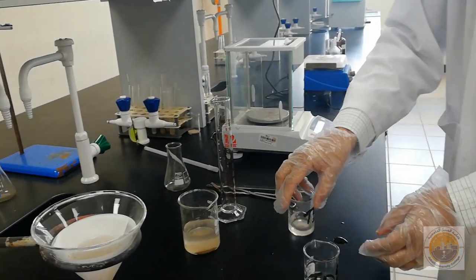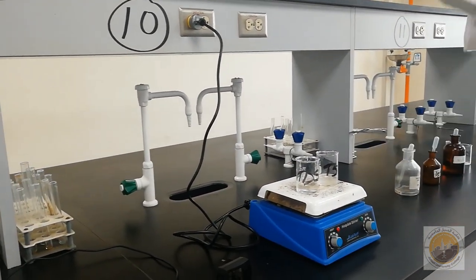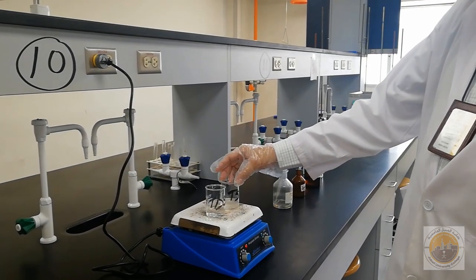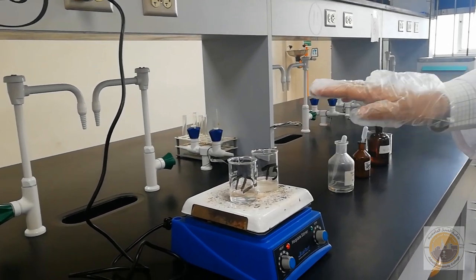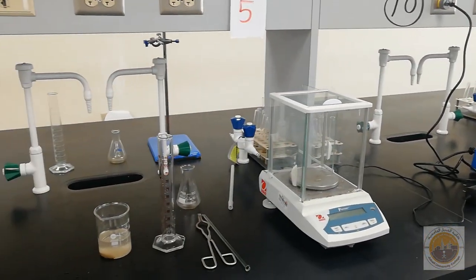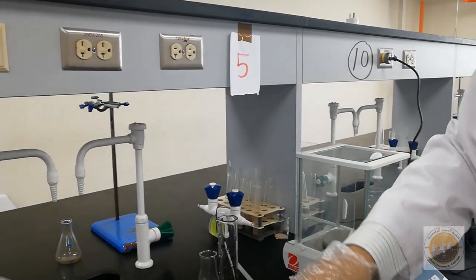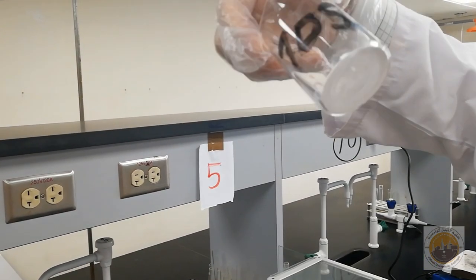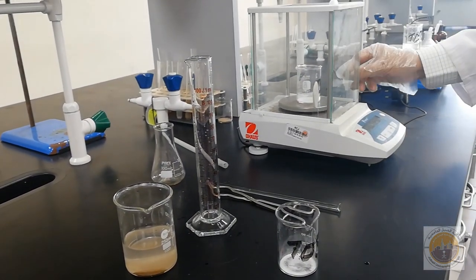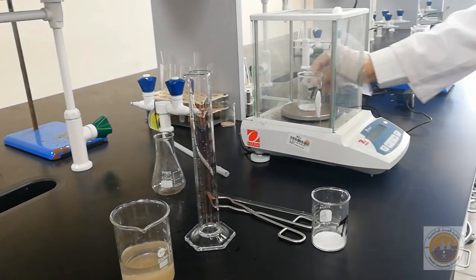Now we have the TDS sample and the TS sample, both 25 ml. We put them on the hot plate. After the water evaporates we get the total dissolved solid from the TDS beaker and the total solid from the TS beaker, which contains both TSS and TDS. We then take the final mass of TS and TDS and record them on the report sheet.